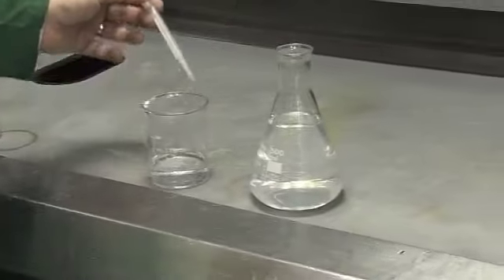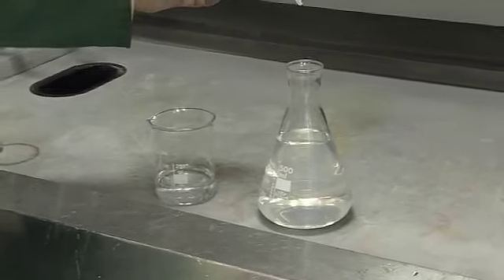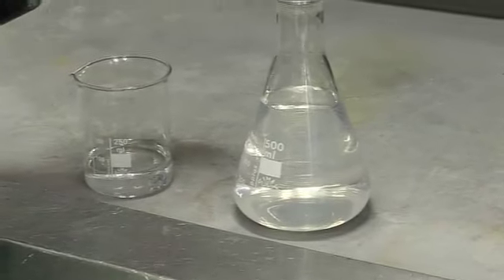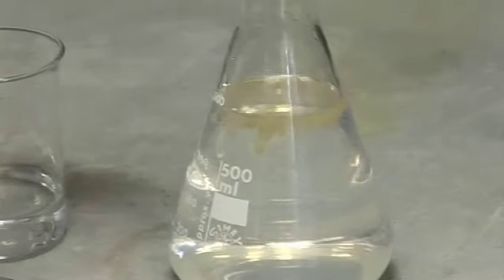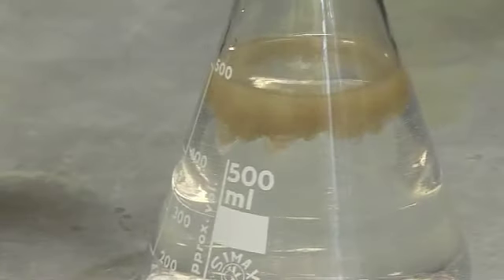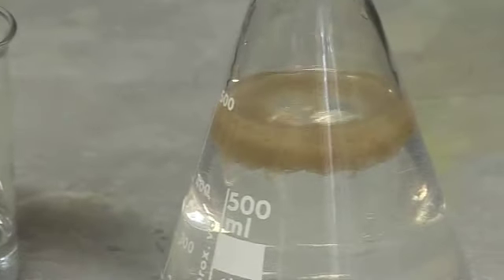The next step for this reaction is to make that silver a little bit more reactive. We're going to do that by reacting it with ammonia solution. As we add the ammonia, we should see a chemical change really quickly. So I add a few more drops. You can see these big clouds of a new product coming. This is actually silver hydroxide.